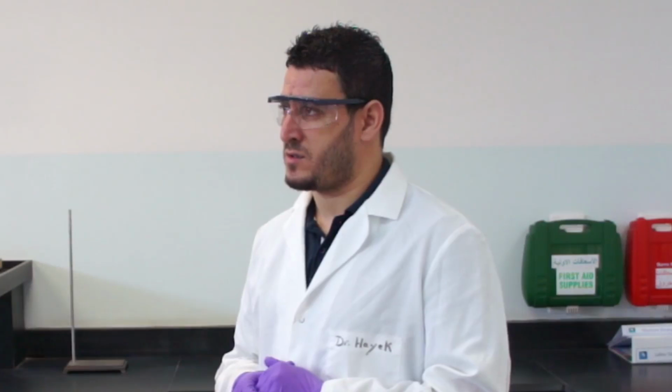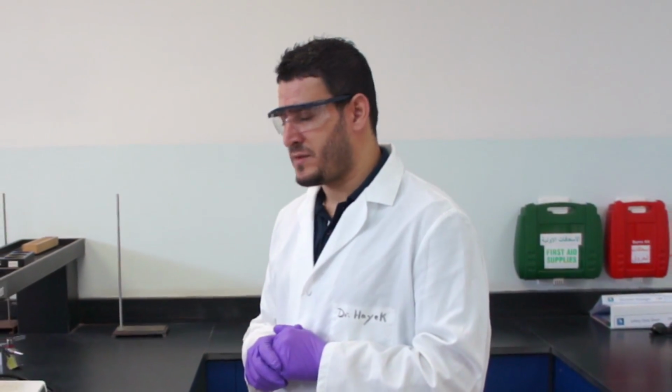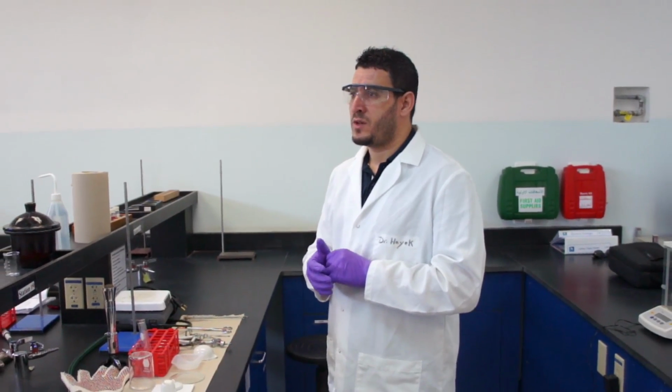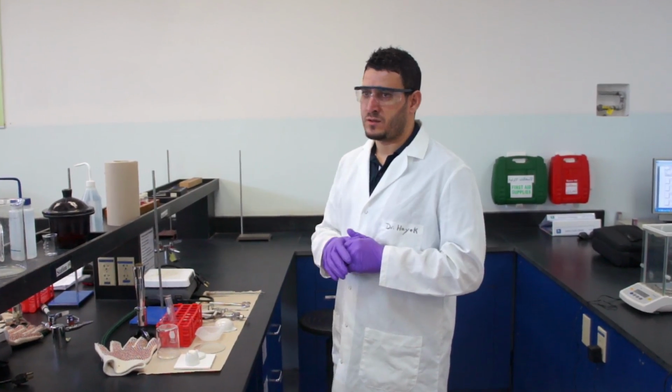Okay, so these are all indications of chemical change. So we have a series of experiments. I think we have 6 or 7. We will be performing these experiments, and later on, you have to decide whether the change that you see is due to a physical change or to a chemical change. We could say that physical change by definition is when the compound changes one of its physical properties, like it goes from solid to liquid or from liquid to solid.